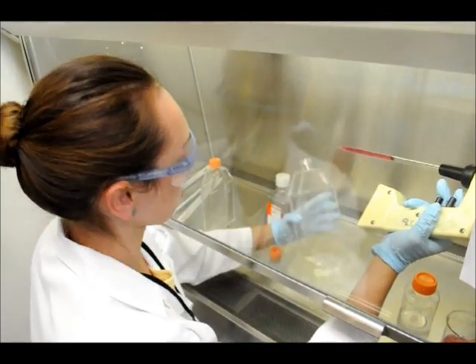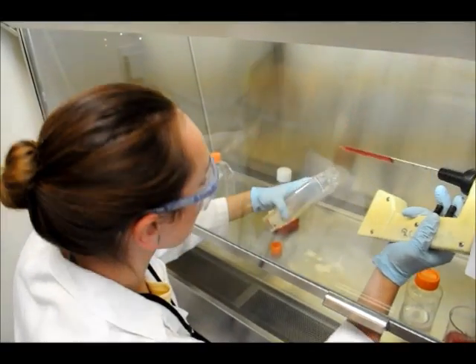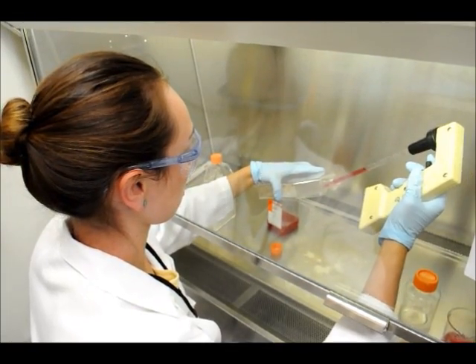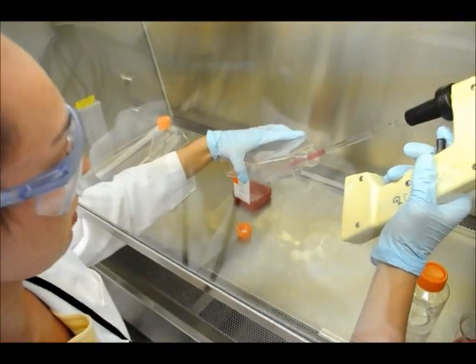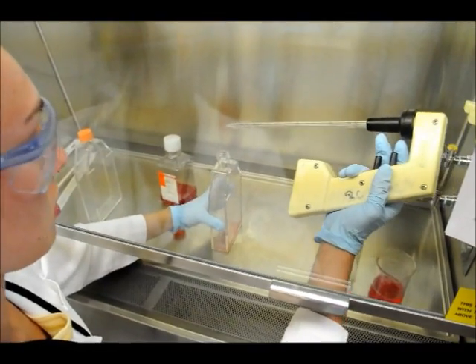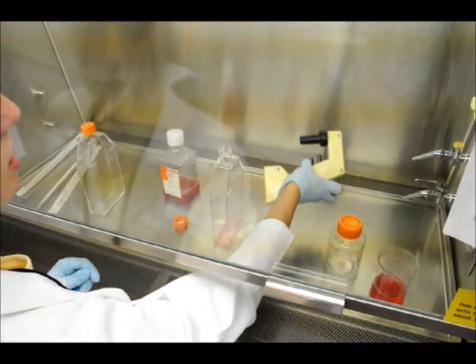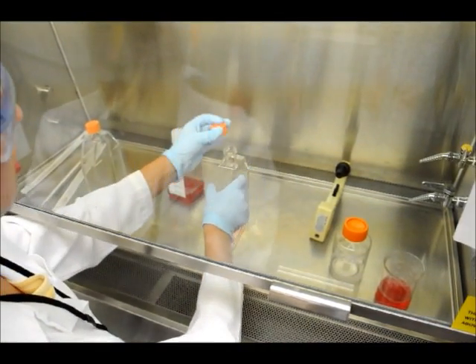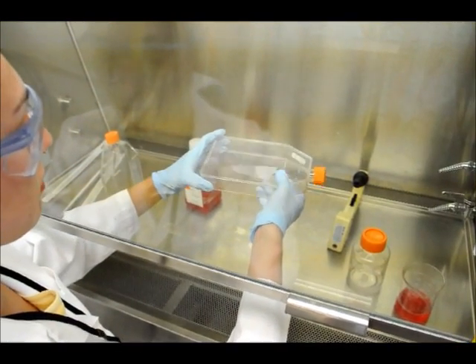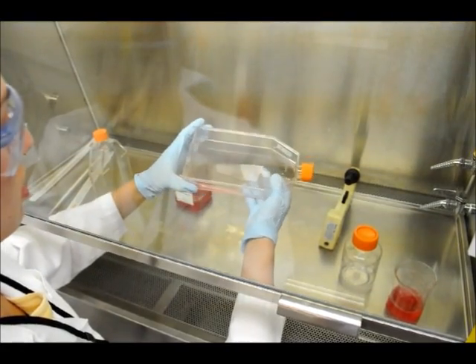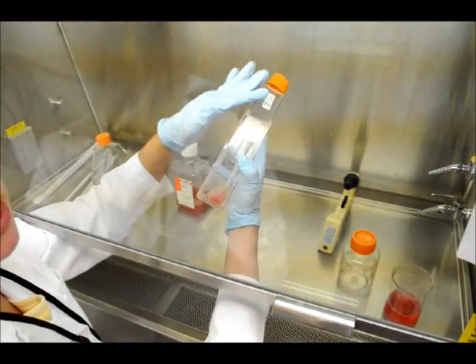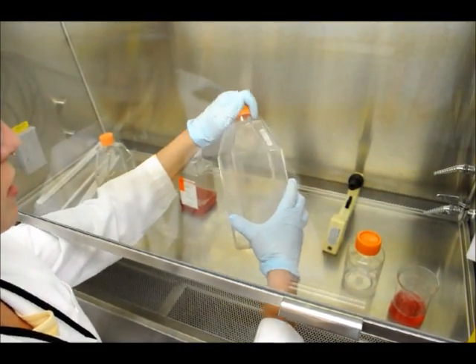Don't lose track of your cells. Make sure you get the entire surface as much as you can. Get rid of the pipette in the biohazard. You can close it, and then you're going to swirl it around so you get everything, and then you're going to dump it out again. Remember with the cells at the top so you don't get rid of those.